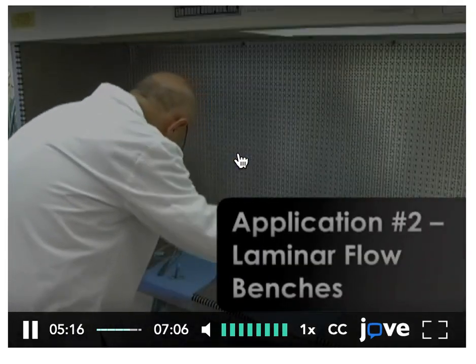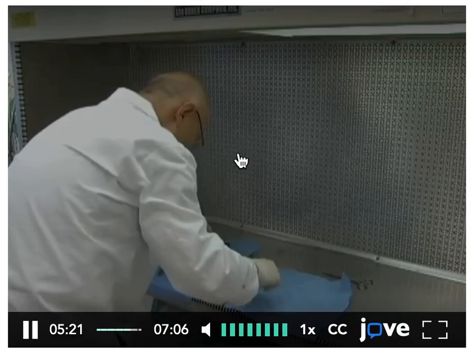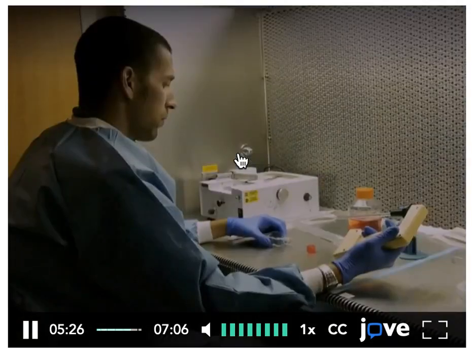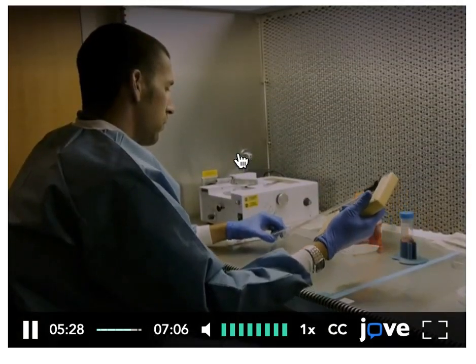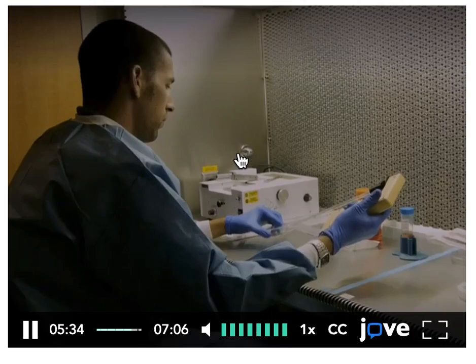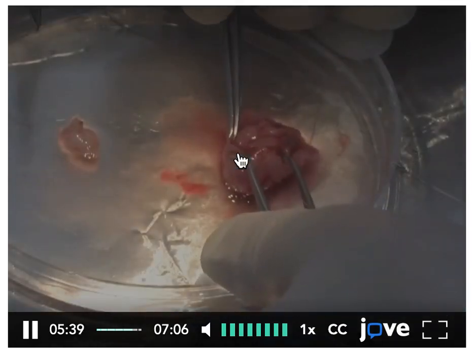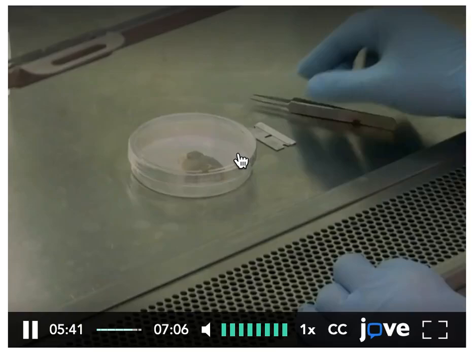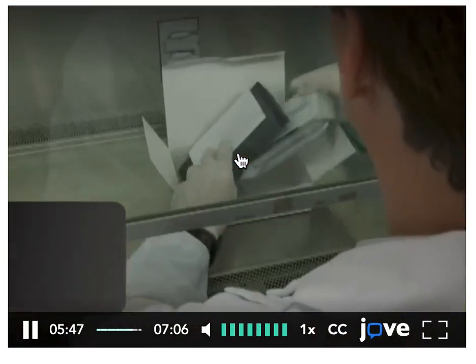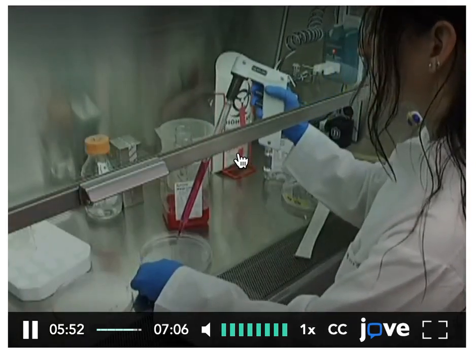Another type of hood is the laminar flow bench. This unit protects the experiment, but not necessarily the user. These units can use horizontal or vertical flow and can be used for BSL-1 experiments with no known biological hazard, such as cell culture without the risk of pathogen exposure. Often, dissections are performed within a laminar flow bench when user safety is not a concern, but the sterility of dissected tissue is important. Biosafety cabinets or tissue culture hoods protect both the user and the experiment.